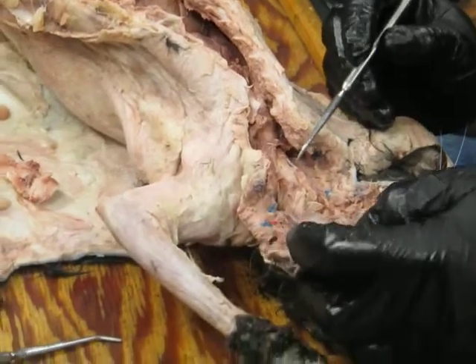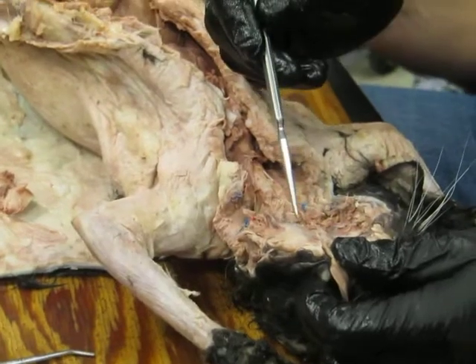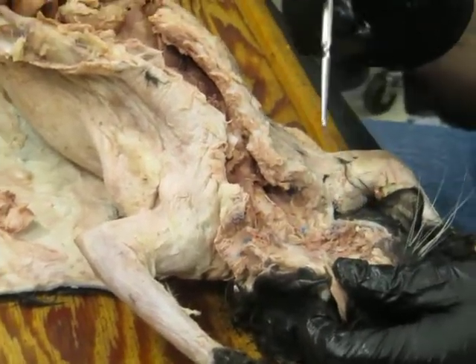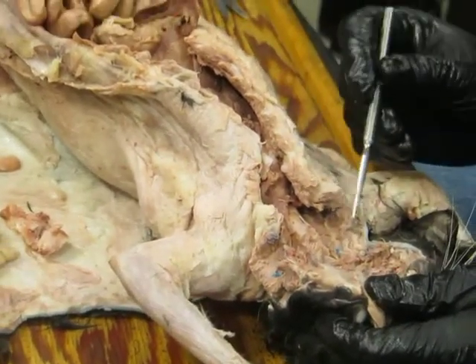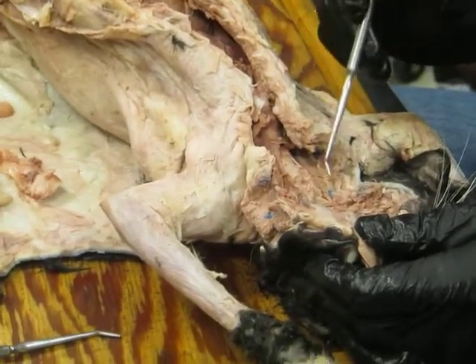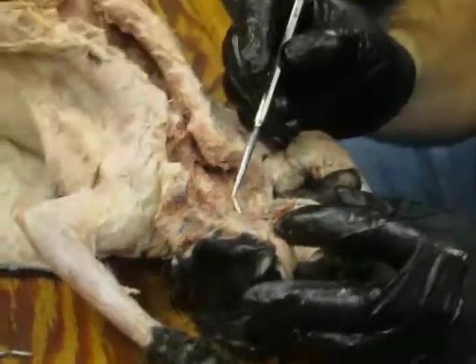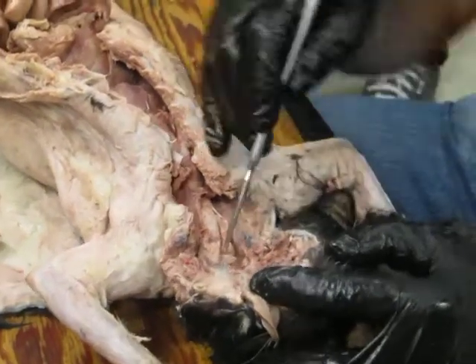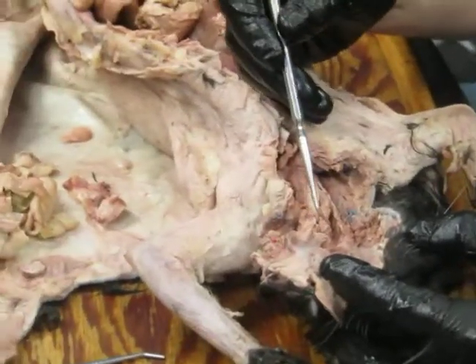So this is a little bit ridiculous, but basically when food comes in, it comes in ventrally into the oral cavity. Air comes in dorsally into the nasal cavity, but then those positions have to switch. And air ends up ventral in the throat region, neck region, and food dorsal. And where that happens is right around here in the laryngopharynx. And basically what happens is there's an opening here into the larynx, and it's guarded by this structure, this little flap.